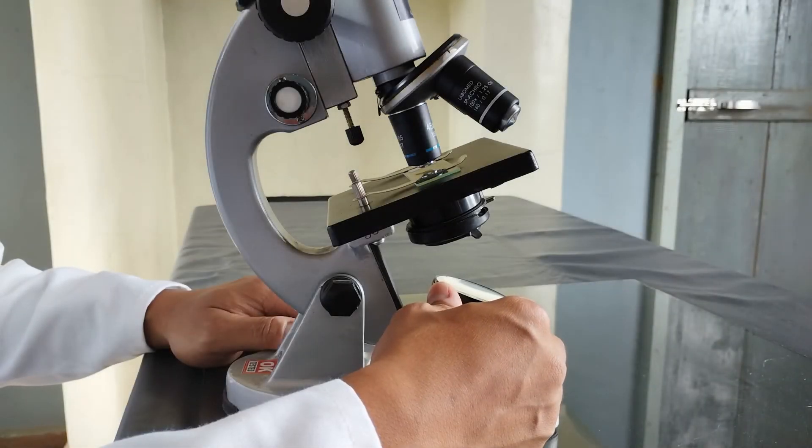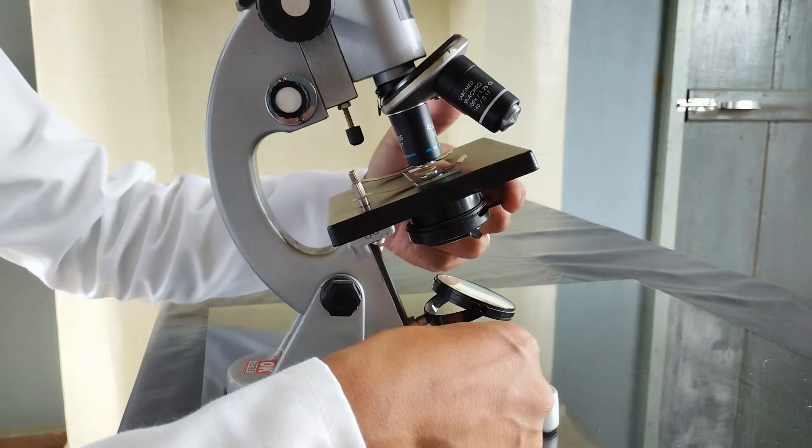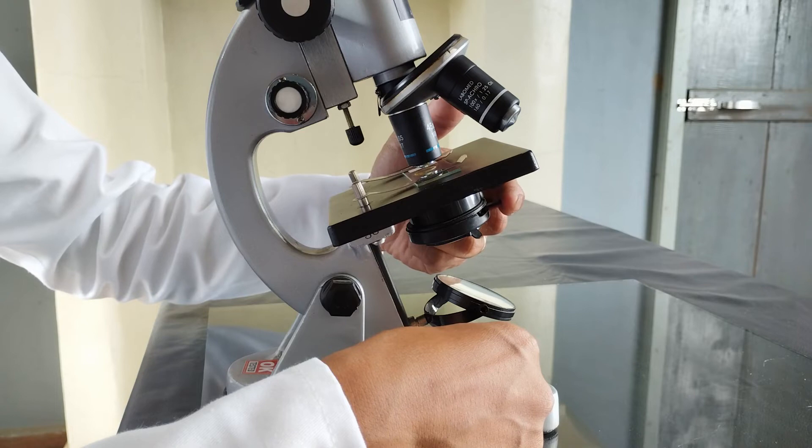Once the specimen is focused under high power, you might need to readjust the lighting in order to attain the ideal brightness and uniformity along with maximum contrast and resolution.